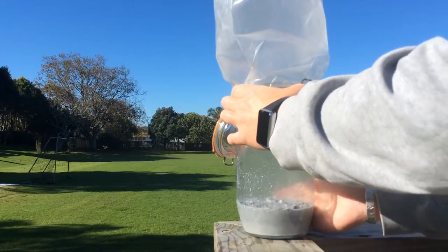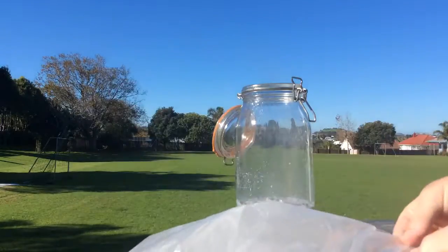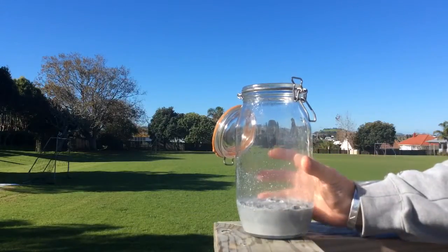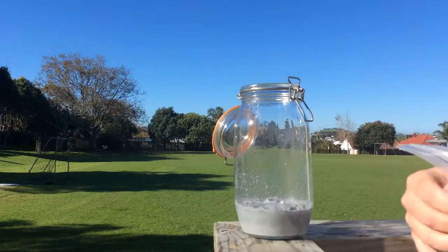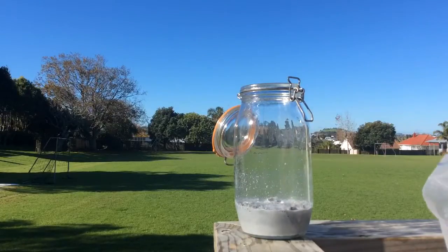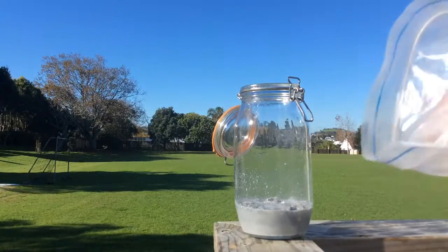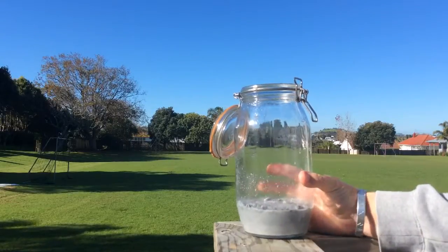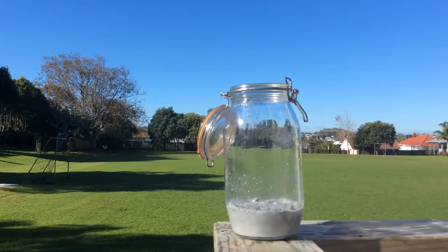Oh wow, that's really hot now. So at this point, this is where I need to be careful that I don't damage anything. Now the contact or the radiant heat off this shouldn't be enough that I'll damage anything, but at the same time I've got to be careful touching it. Now, just to give you an idea of the gases that I'm collecting, if I just puff that in front of the camera, you can see all the steam escaping. That's hydrogen gas, and if I was to light it, it'd make a fireball, which we're not going to do. Not today anyway, but that's a cool experiment to do if you're able to do that sort of thing.